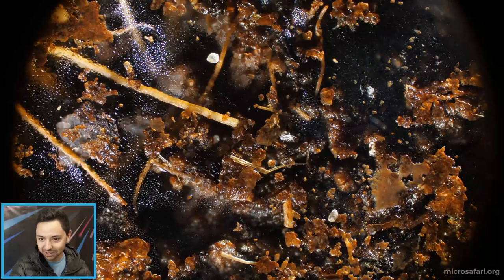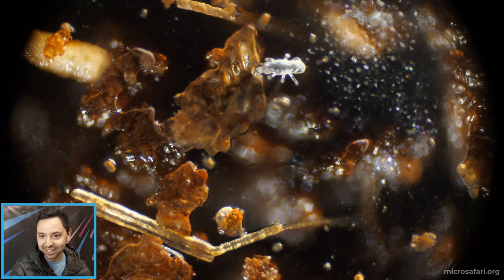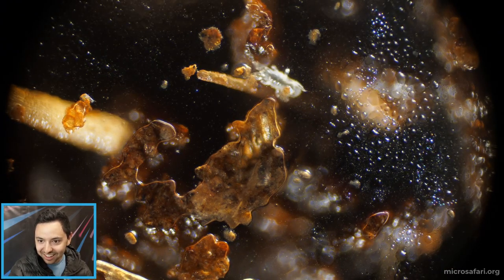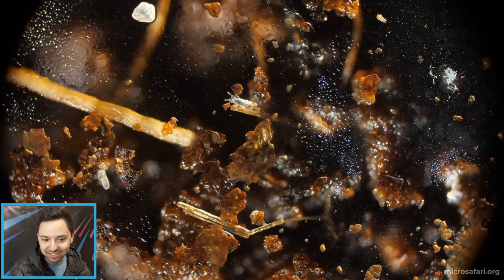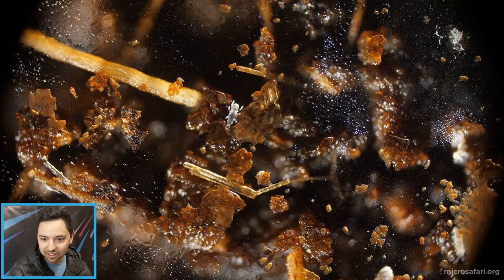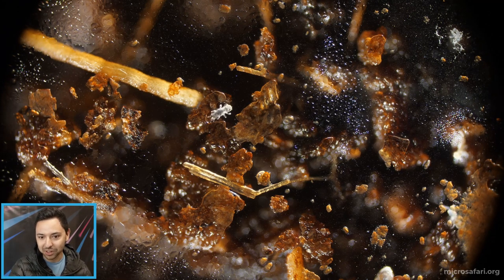Oh hello, what is this? I think this might be a different type of soil mite — I think it's eating right now, maybe its tongue will come out. Let me zoom out a little bit. You can tell this one's different just by the way it looks — it's all long, way longer than the other ones.